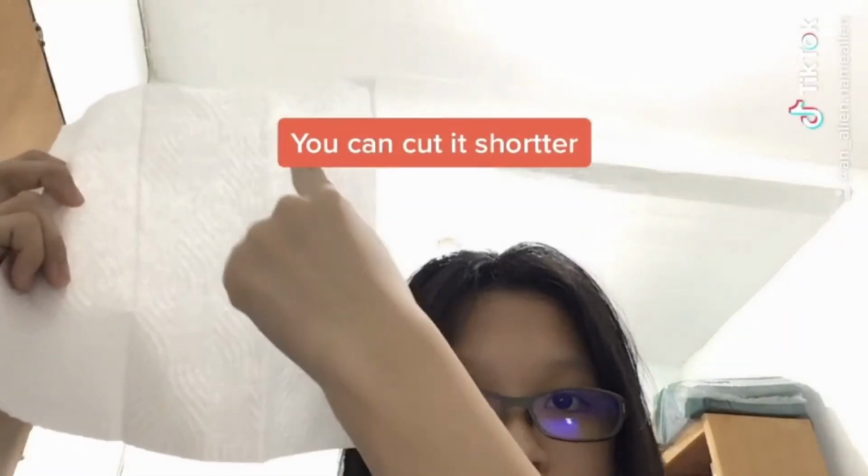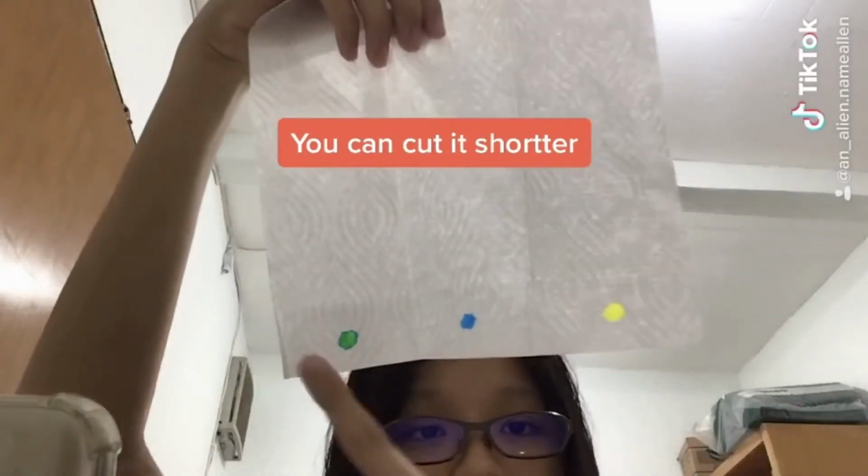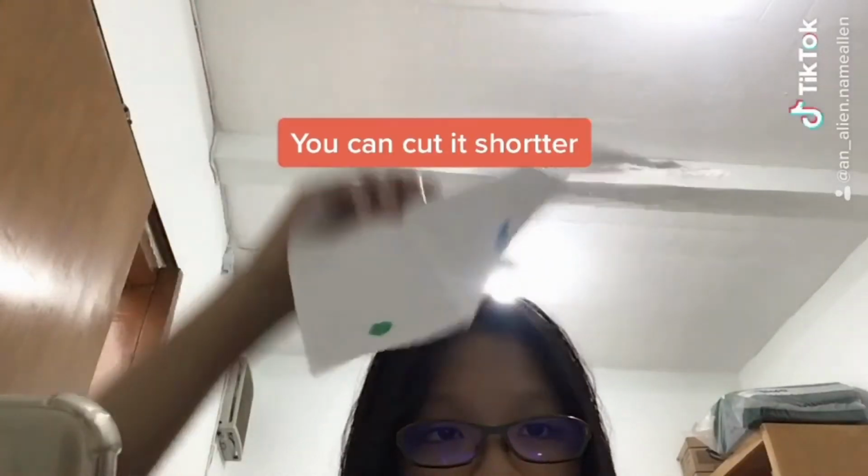Now make a line about 1 centimeter from the bottom and the top using a pencil, and make a dot using the dye in between the line. Now fill the jar with some water and dip the paper in the jar, making sure the water does not touch the line. Now we wait.